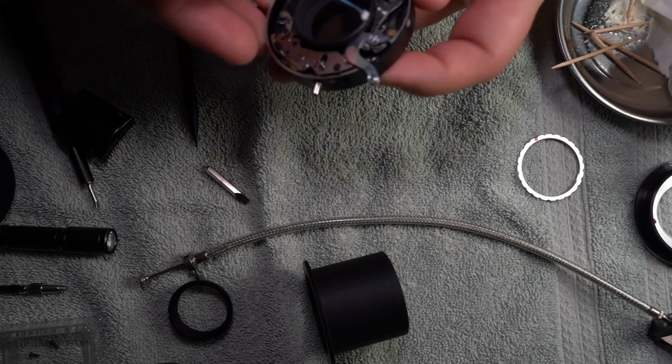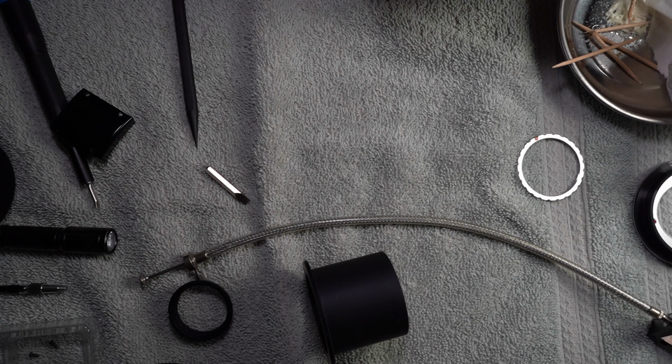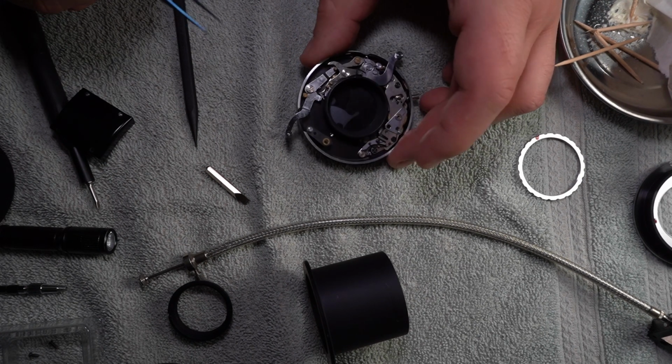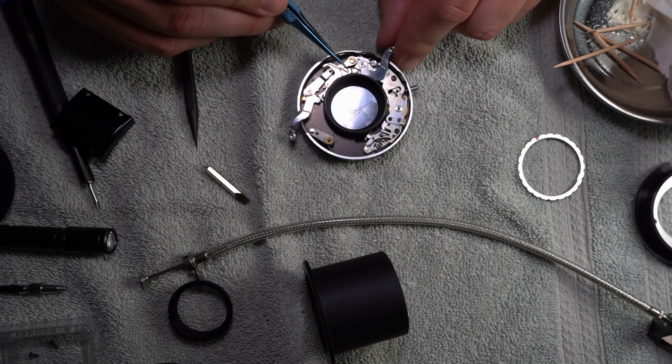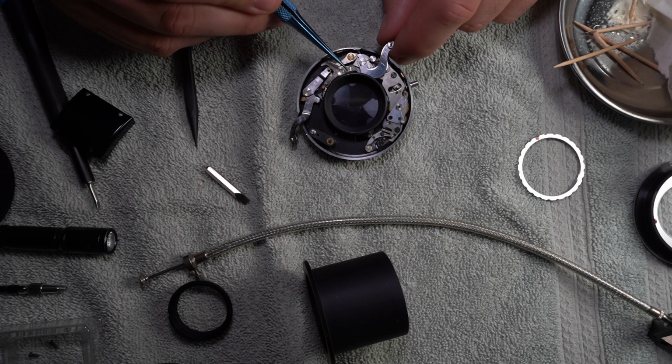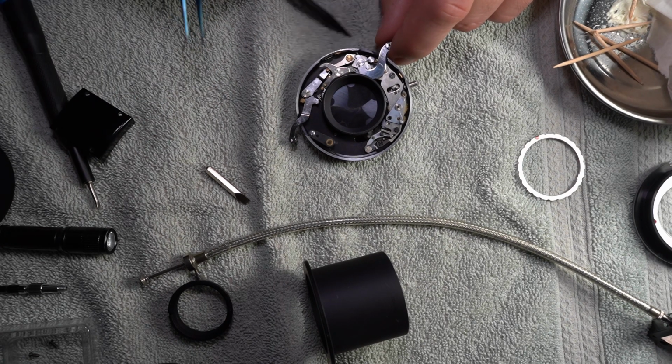Okay, so now let's see. I'm sorry, but I have to be able to actually see this. Is there grease on that? Oh, there actually is grease on that. You're probably not going to be able to see this unless you're watching on a really large screen. But there's on this linkage here, let's see if I can do that. There we go. On this here, in fact, maybe if I bring that up a little bit, you can see better.